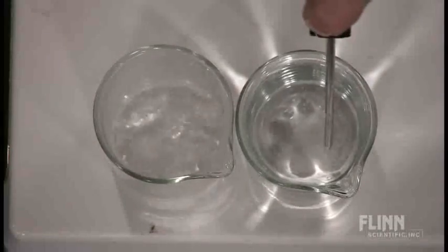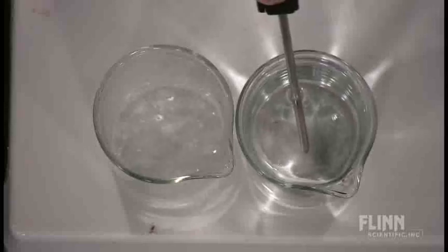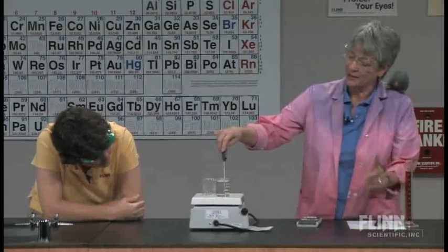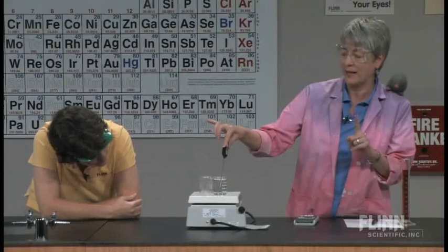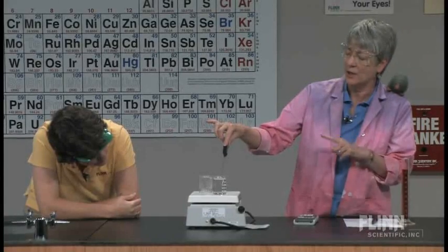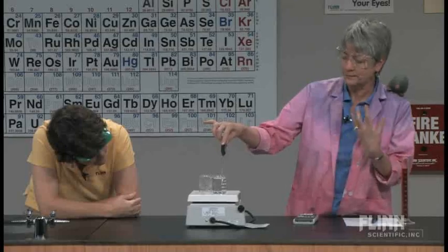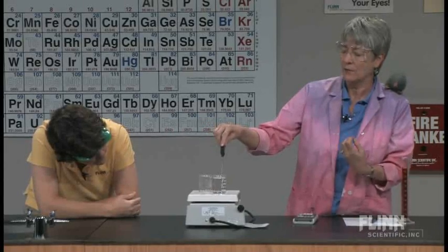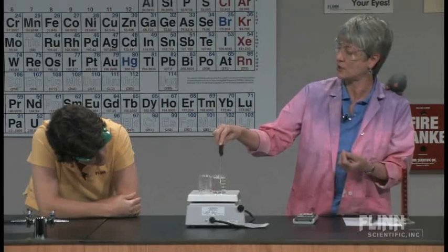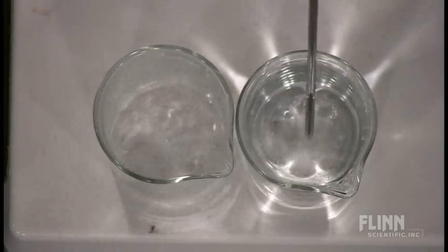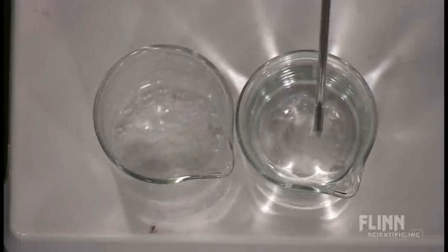Isn't there anything more exciting than watching water boil? So this isn't one of those demos that are exciting. But while I'm doing it, the students should be thinking about, how am I going to do this calculation? Exactly what is she doing? So the whole point of this is for them to think through, how am I going to measure that heat of vaporization, which is the amount of energy needed to go from the liquid to the gas.